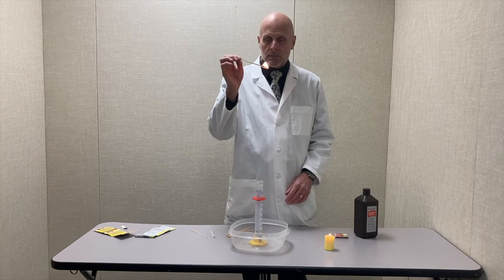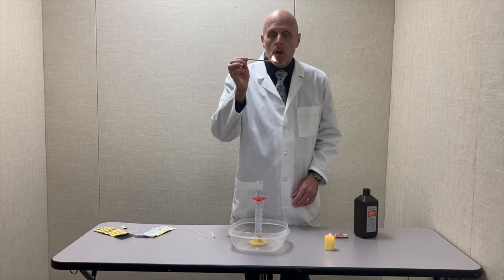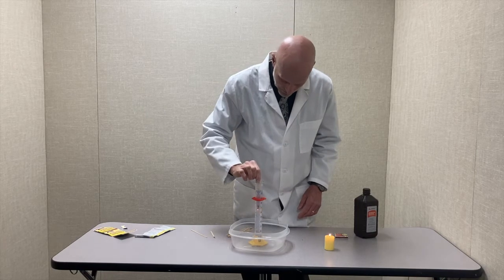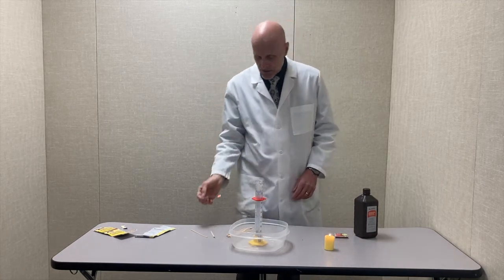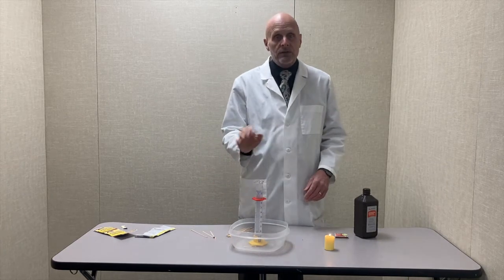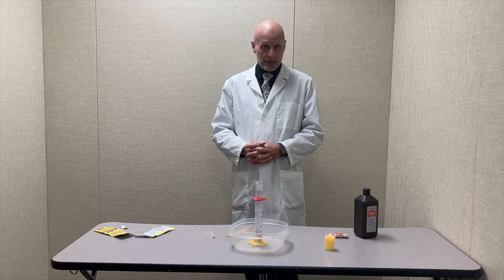Let me see if there's any more in there. Notice the color of the flame here — yellowish orange — and then it burns bright white down inside. So I've made pure oxygen out of yeast and hydrogen peroxide, a solid and a liquid making a gas.